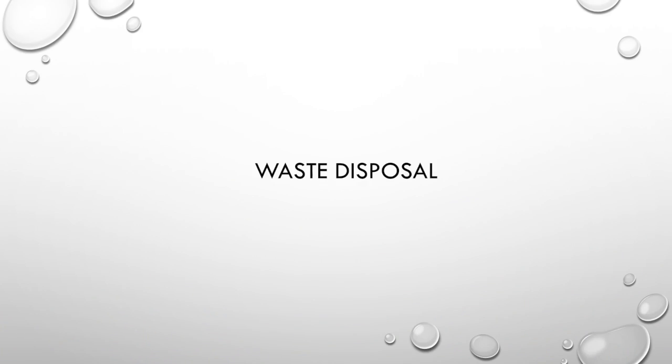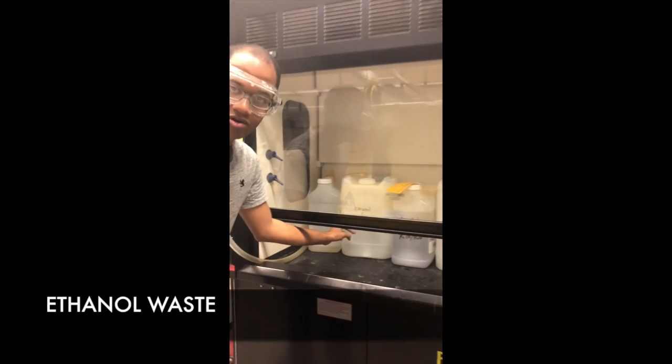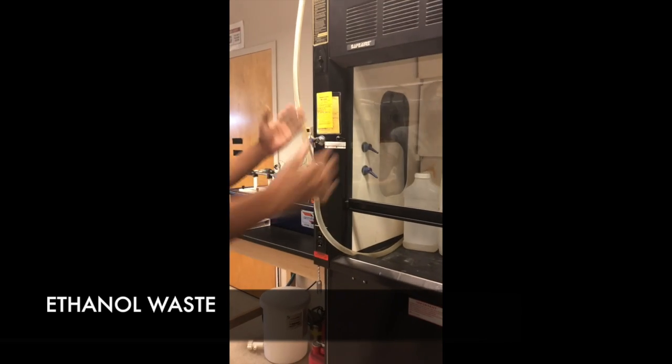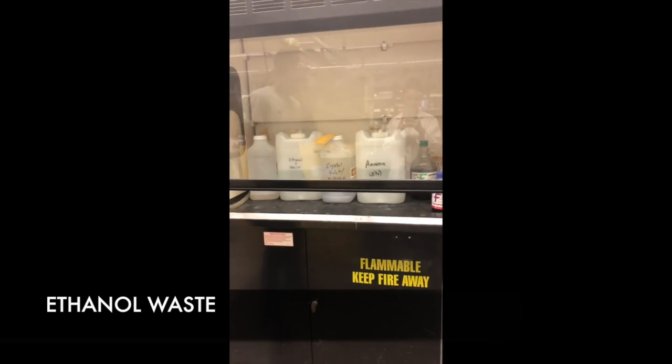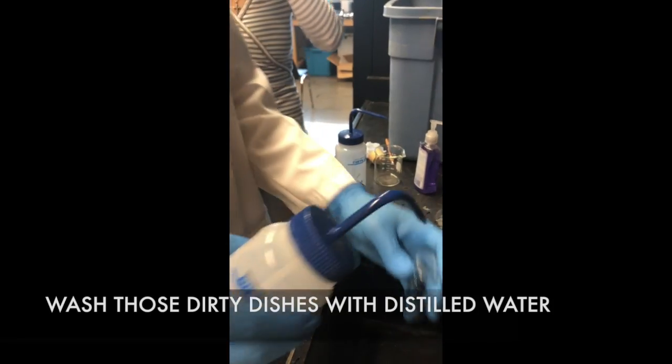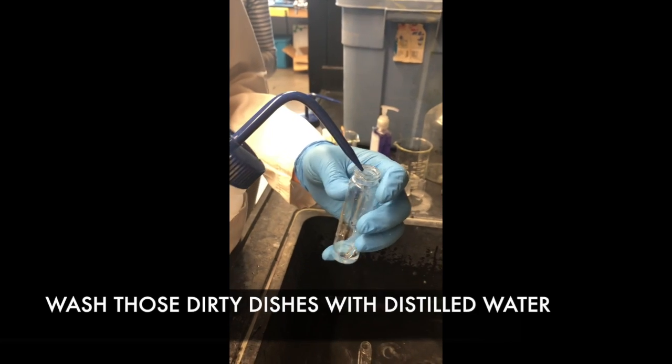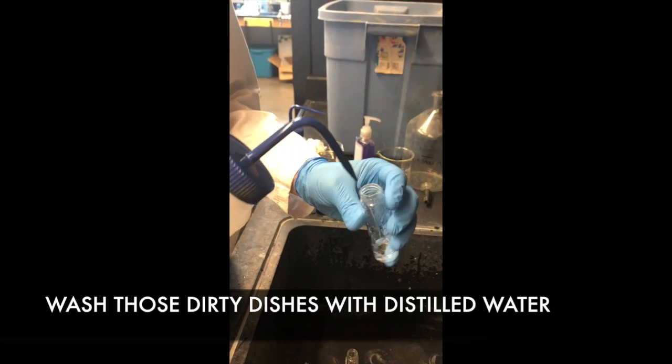After you've completed your experiment, it is important to dispose of everything properly. Here we have the disposal unit for ethanol. It's kept under the fume hood. Shut the fume hood once the ethanol is put in the container. Water can be disposed of in the sink. Also, don't forget to clean all your equipment using distilled water.